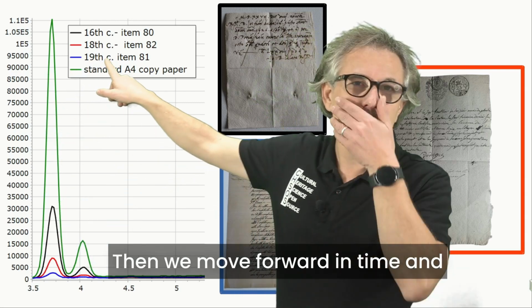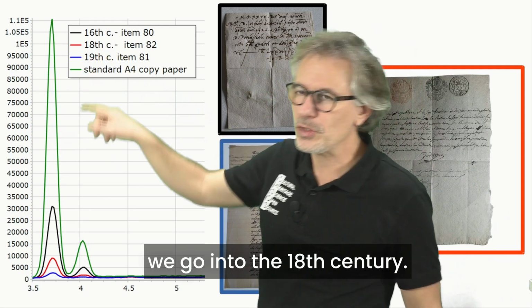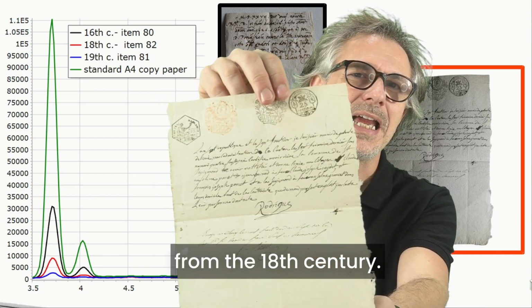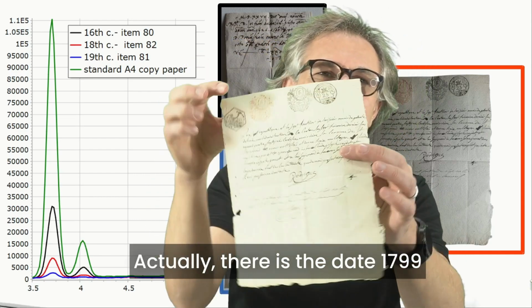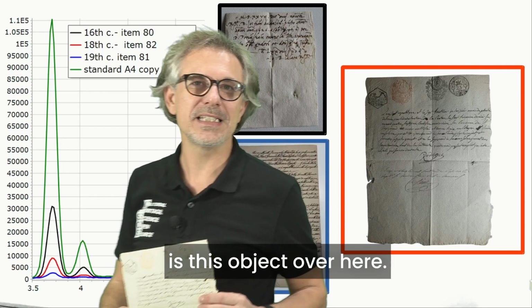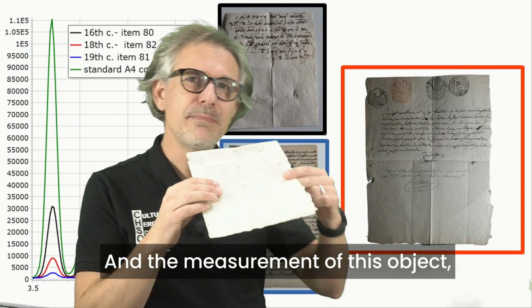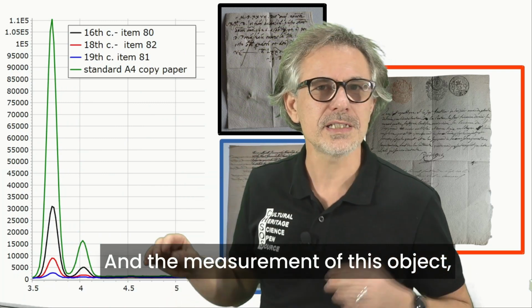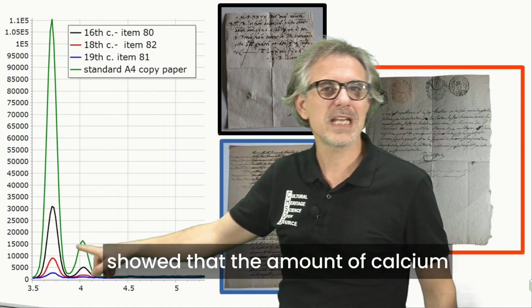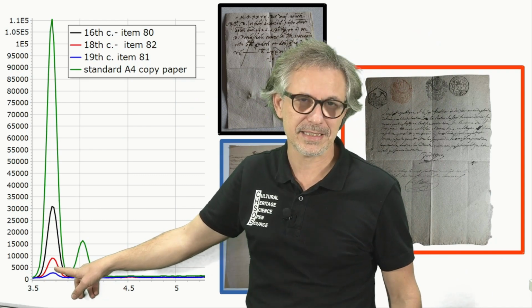Then we move forward in time and go into the 18th century. We have this other item from the 18th century. Actually, there is the date, 1799, on this object. And the measurement of this object, the red one, showed that the amount of calcium is much less.